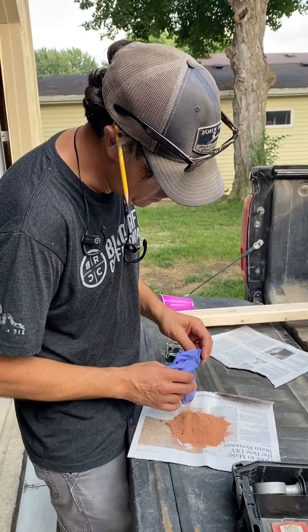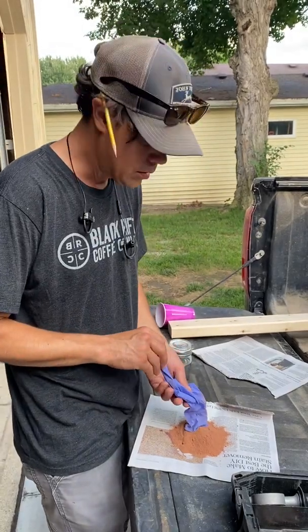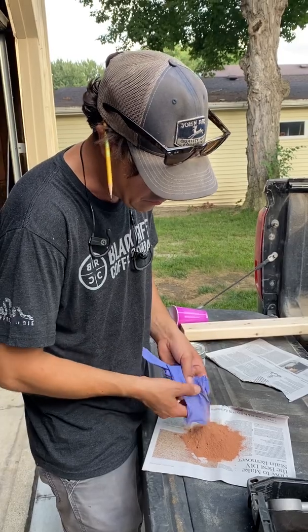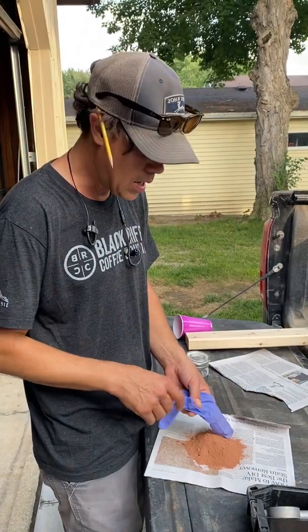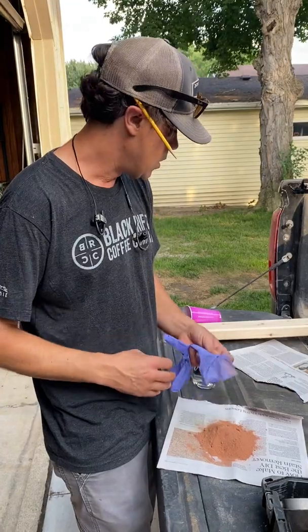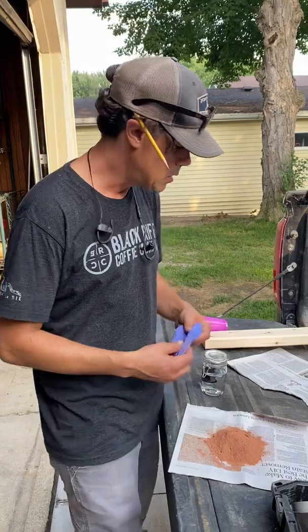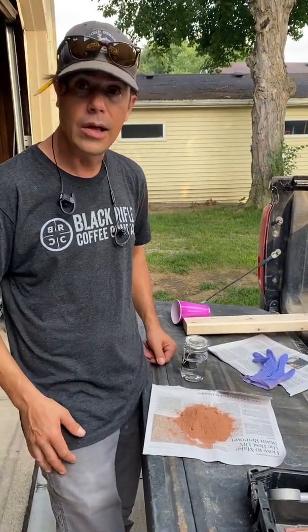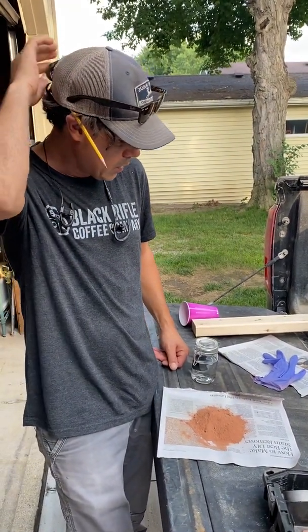You can tell, because it's powder, that it's also high clay content, which means there's a whole lot of small particles, right? So soil is made up of different size particles. Primarily, they're categorized as soil, right? Sand, number one, which is the largest particle. Silt, which you can kind of think of like a river bottom, right, is silty. And that's a lot of your black loams, things like that. And then clay. Clay is the finest particle, and you would think it's the smallest particle.